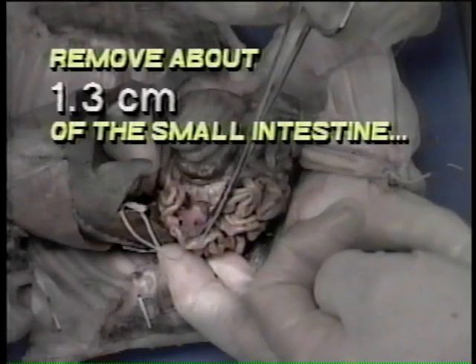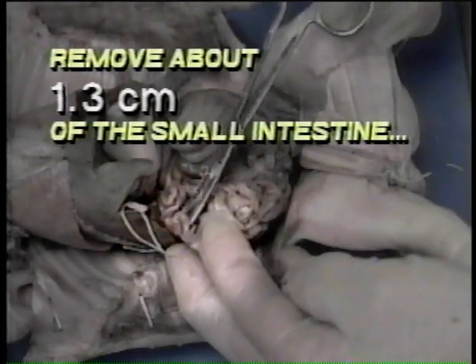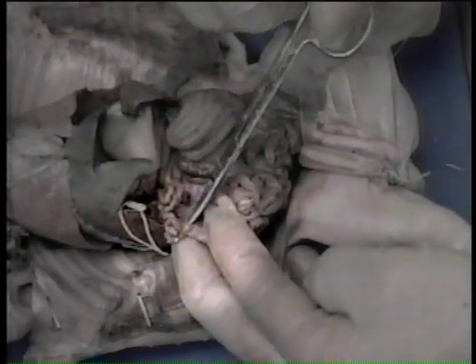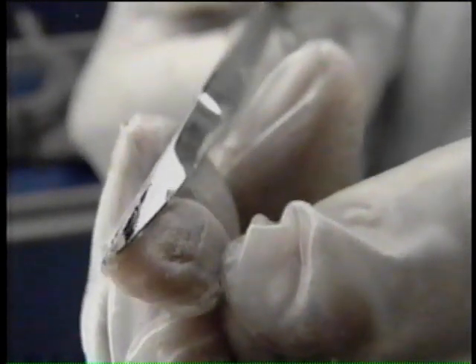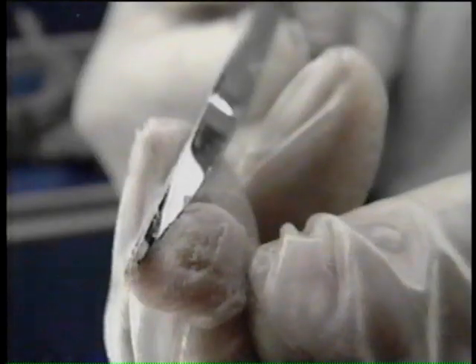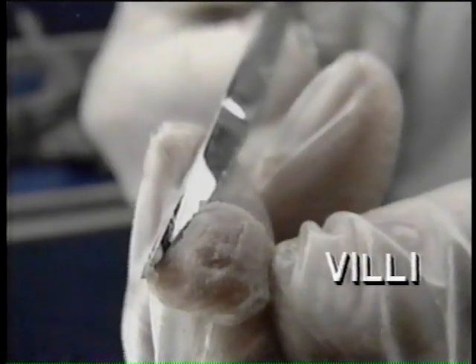Remove a small segment of the intestine, about 1.3 centimeters. Open it longitudinally. Flatten it out and examine it. Notice the velvety appearance of the internal lining. This lining is composed of numerous finger-like projections called villi.